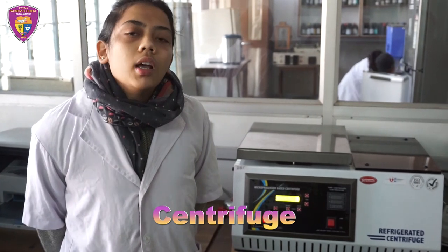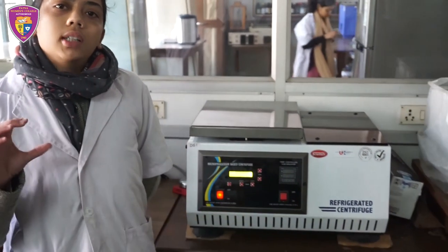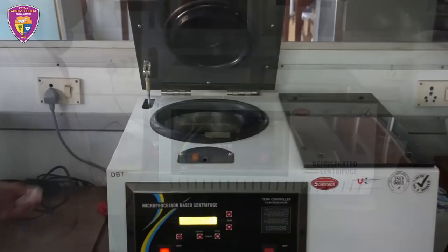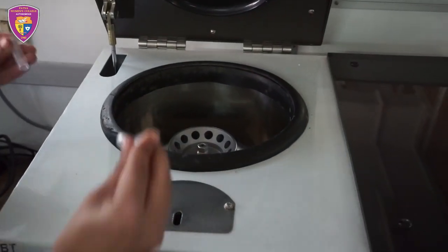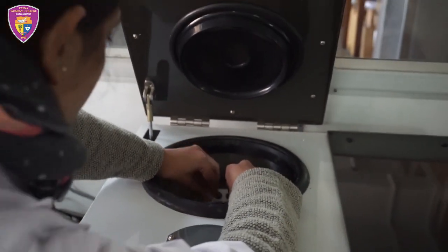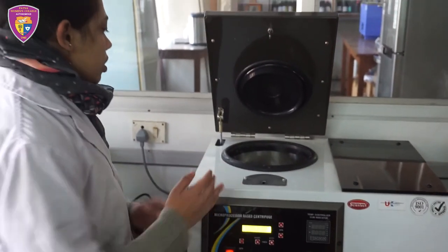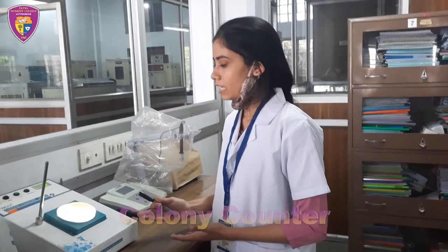This is a cooling centrifuge and it works on the principle of sedimentation. Substances with higher density settle at the bottom of a solution. The two tubes are placed together at the same distance facing each other so that they maintain equilibrium.